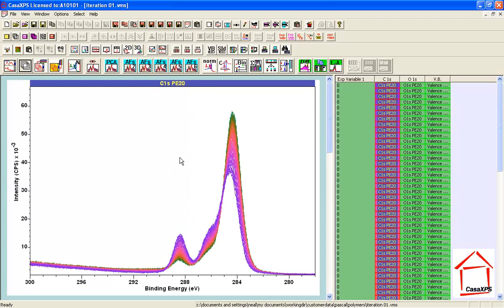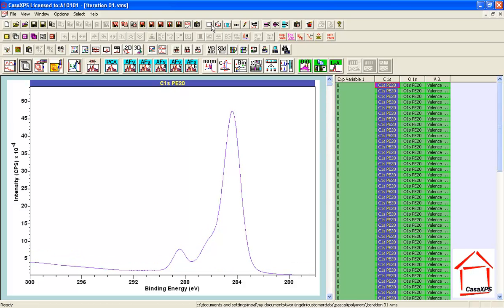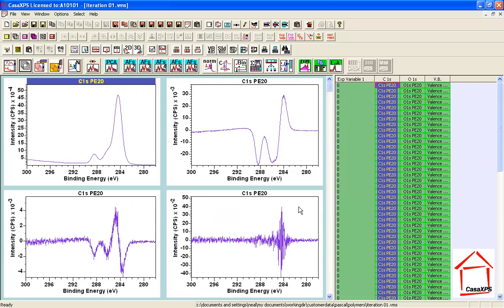So there's a certain consistency in these changes that makes us believe that these are genuine changes in the sample and not some sort of errors in the measurement of the sample. If we simply consider the carbon 1s, we can do calculations based on principal component analysis and evaluate how many different changes we can mathematically determine within these data. So when I press the PCA button, then the data are transformed into abstract spectra or abstract factors, and these abstract factors are gathering the signal information and hopefully partitioning it from the noise information in the data set.